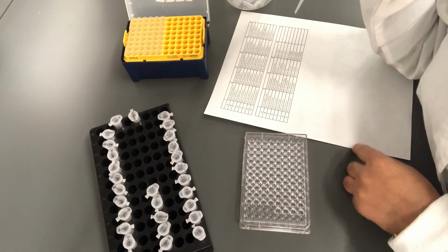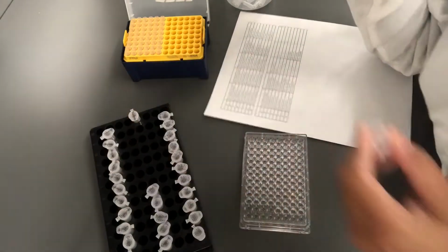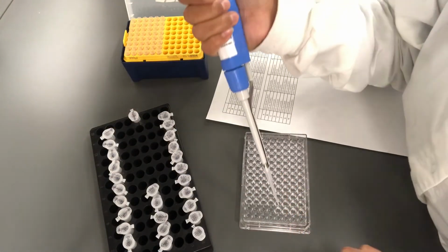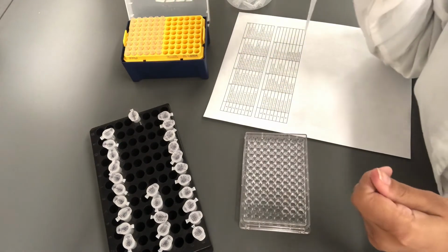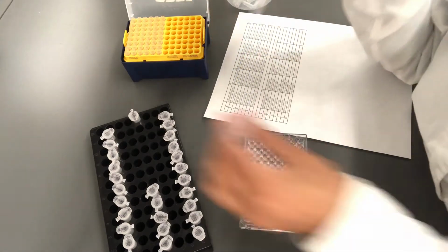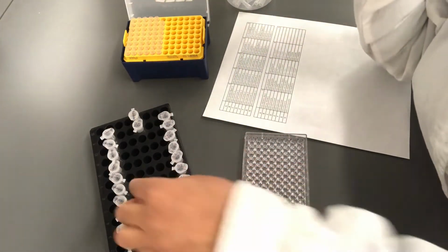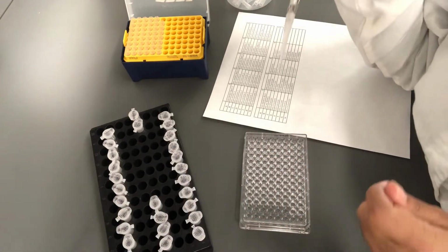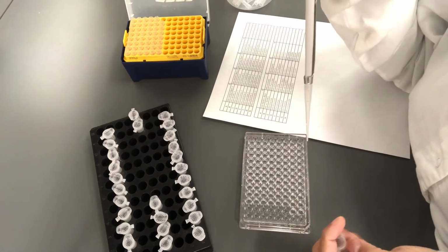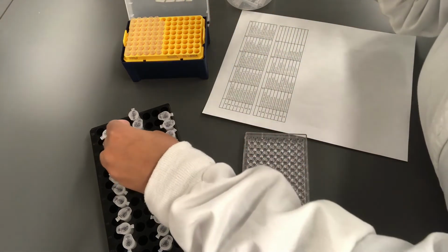Now comes the time to switch to the nitrogen experiment. The first one is the negative control, so I'm going to add the plain mineral salts media, 150 microliters of that. The first two are always controls, so two of them are going to be mineral salts media. Then I'm going to add different nitrogen sources following the plate layout. You don't have to remember what I'm adding here. You'll have the plate layout with you to follow.